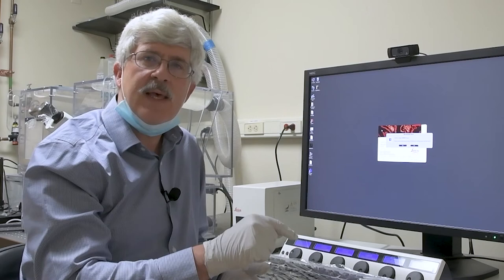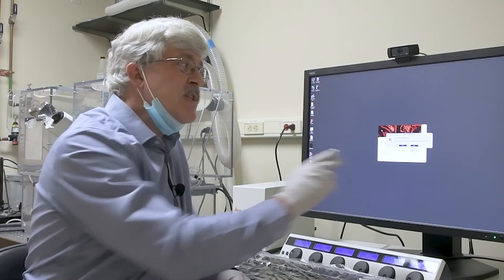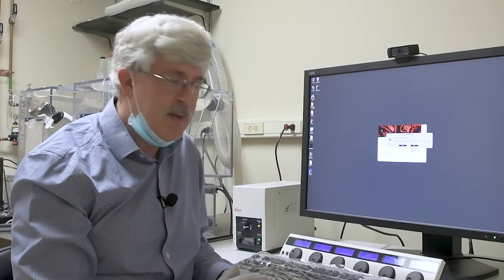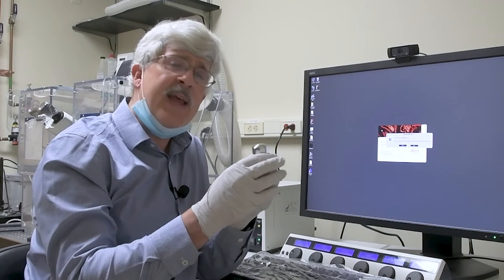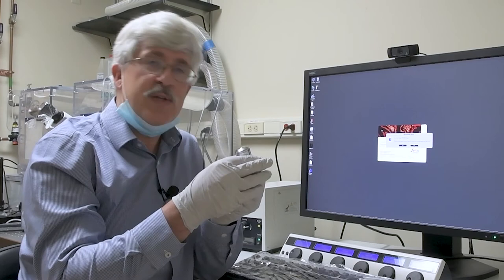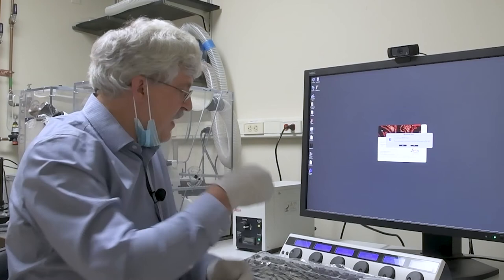Once you've started up the software it will continue until it gets to another pause point. Here it's asking do you want to initialize the stage. Initializing the stage allows you to mark locations and come back to them again or do stitching. If you're not going to be doing any of that, I want you to hit no. If you are going to do one of those things, you'll be hitting yes. But before you do that I need to give you a warning and save you some money. Several years ago we had this objective in there, and when you initialize the stage it starts moving and anything that gets in the way gets run over. This lens got run over and got scratched and it only took about eight thousand dollars to fix it. So be careful, let me show you how to avoid it.